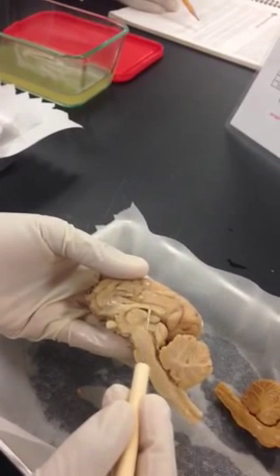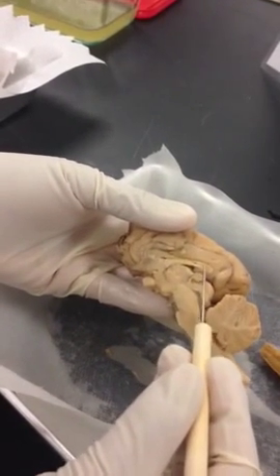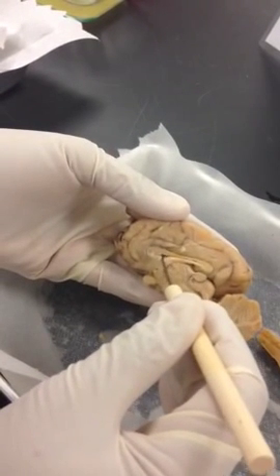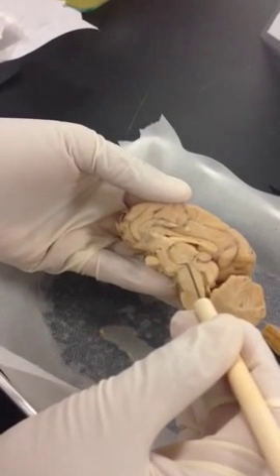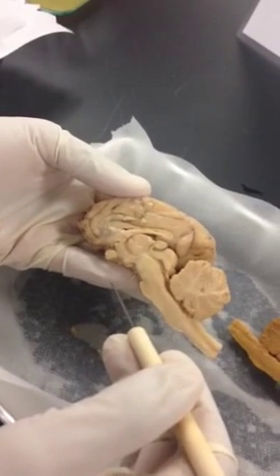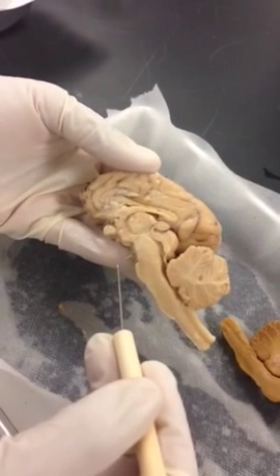So this is your corpus callosum. Okay, so they call this region fornix, but let's call this upper portion where it looks like a letter C the corpus callosum. And if I pass this needle inside, can you see a space? And can you see a space where I'm passing the needle around? And see it's continuing? And it ends up here in this space, right? So these are all spaces that have cerebral spinal fluid for the passage of the fluid. We call these ventricles. So there are different ventricles.